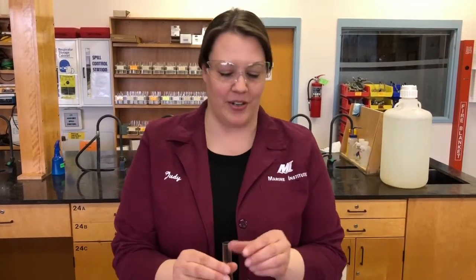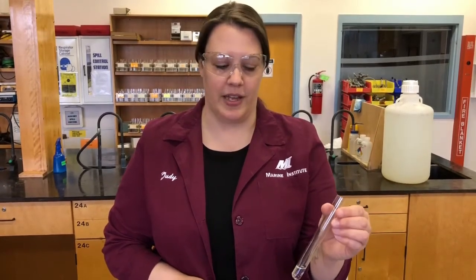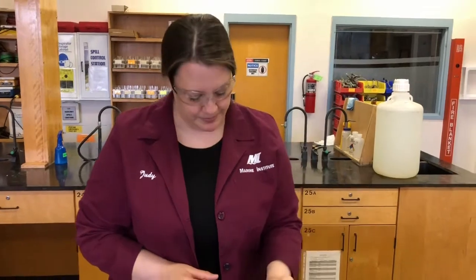So the other part of our observation in this case is that it produced a gas, but also that it produced an odorless gas. Again, our observation: we have bubbles being produced and no odor being given off. Our deduction based on that is that C and D reacted to produce a gas that was odorless. So that's that one.